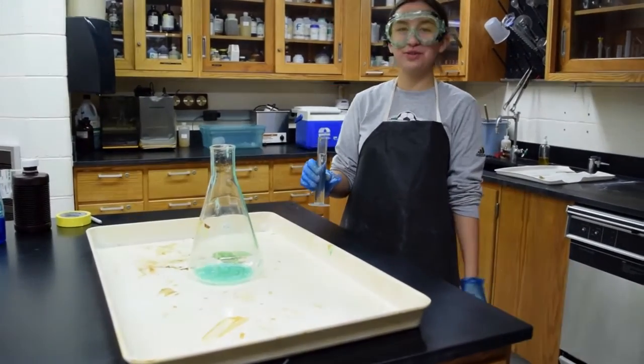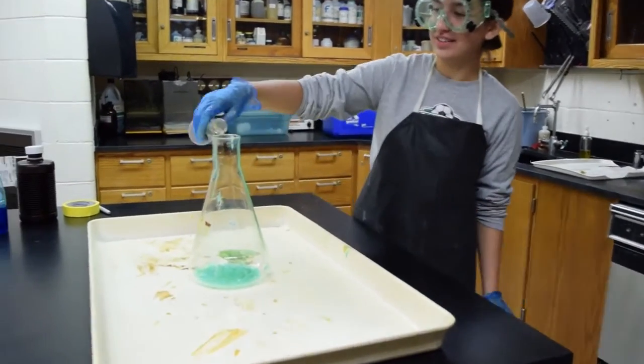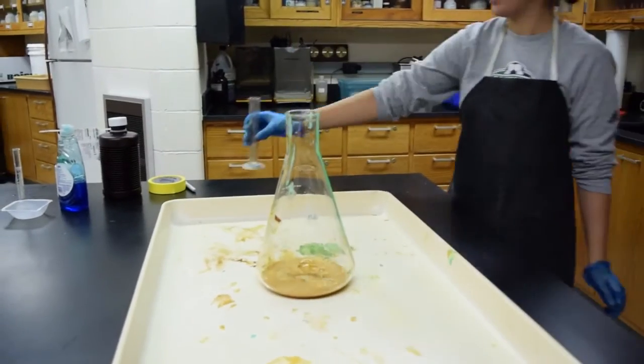Okay, so you're going to measure 50 milliliters of hydrogen peroxide and then pour it in as fast as you can, and then just watch the reaction happen.